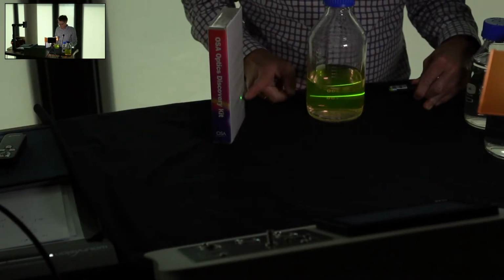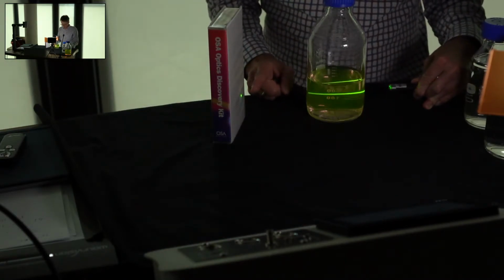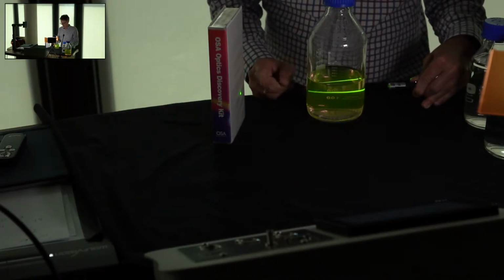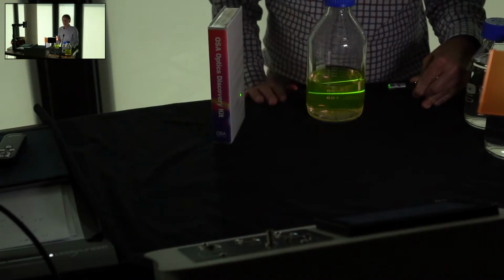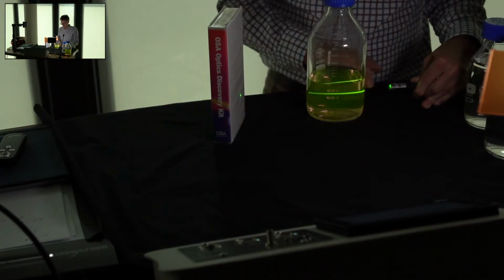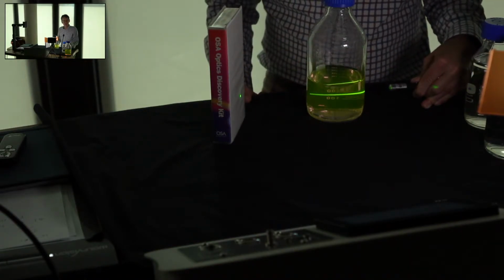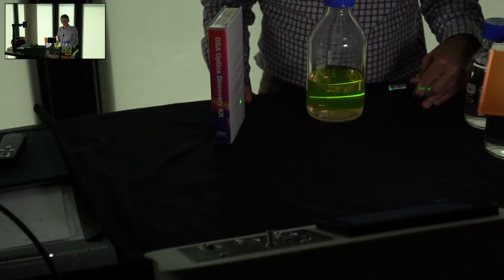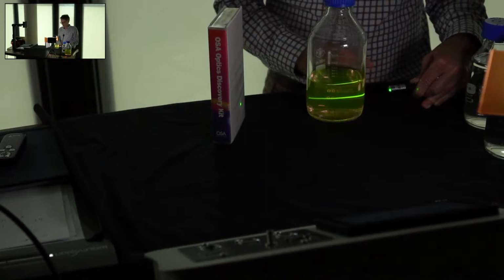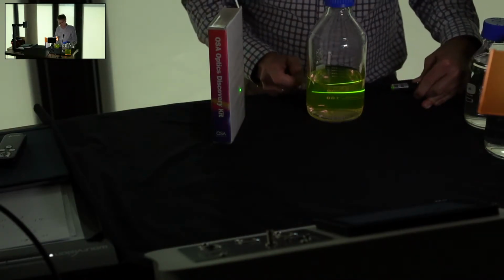Actually, you see that this sample is sufficiently dilute that the beam is coming through. In fact, if you measured the intensity here, it's hardly diminished. You can see why absorption again would be hard to do. Comparing this intensity with this intensity, or the intensity here and the intensity there, with one another, there isn't enough absorption for you to do a reliable measurement. Maybe you have 100 photons, 100% of the energy going in here, maybe 99 coming out. Hard to measure, just a 1% difference.